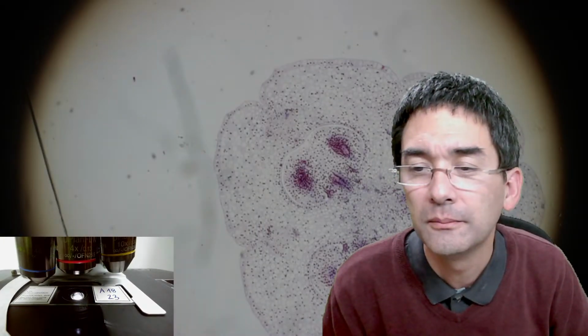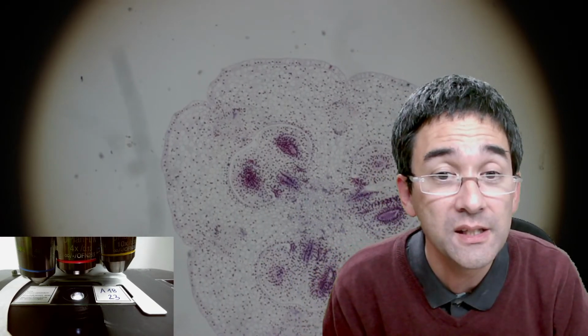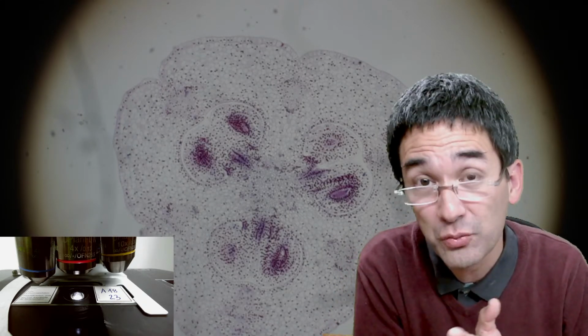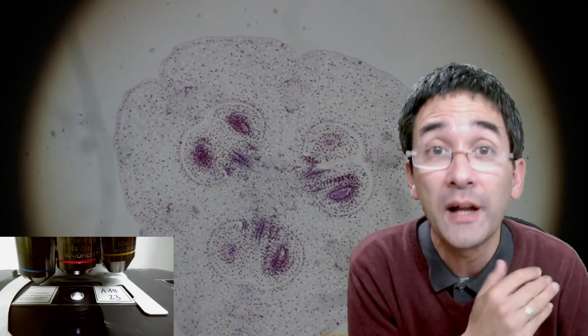Yeah, you have to get the right objectives for the right specimen. Yeah, this is too bright. Basically the reason why I have so many objectives is because it helps me to choose. It's because I'm doing live streams and then YouTube videos. It gives me a little bit more flexibility without having to crop.